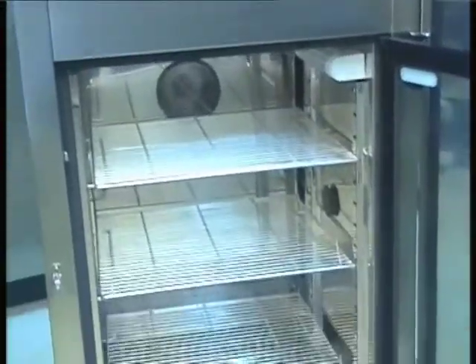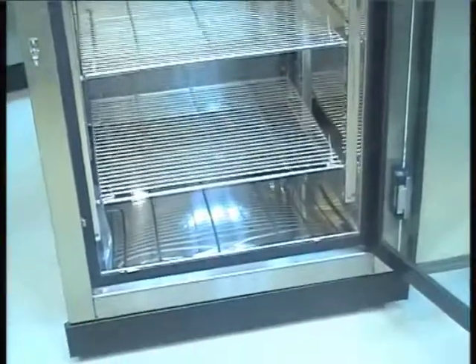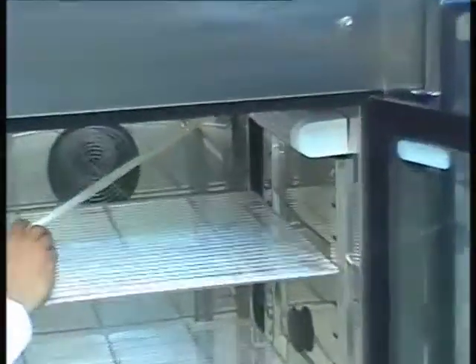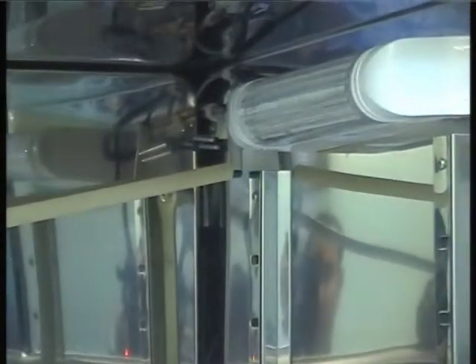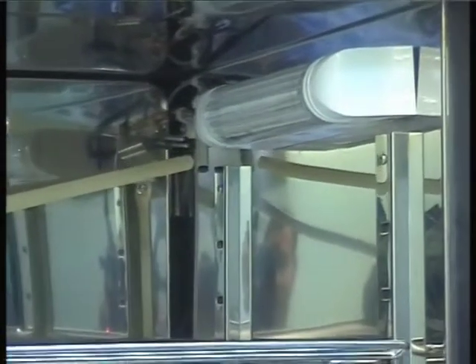The stability chamber also contains two sensors which are mounted in the inner chamber: the RH sensor and the PT100 sensor. The RH sensor measures the humidity and is connected to the digital humidity controller which in turn controls the boiler heater.